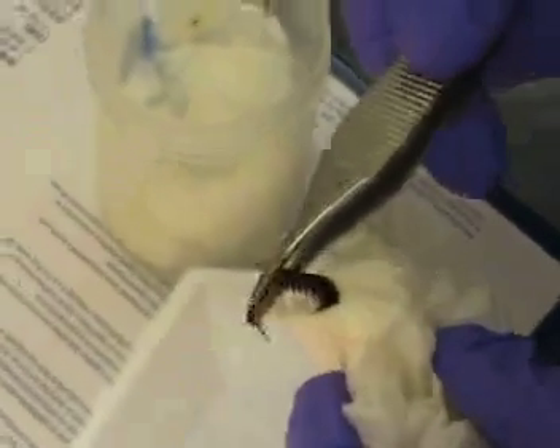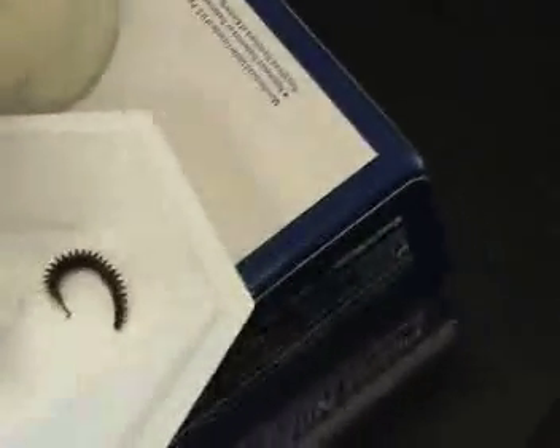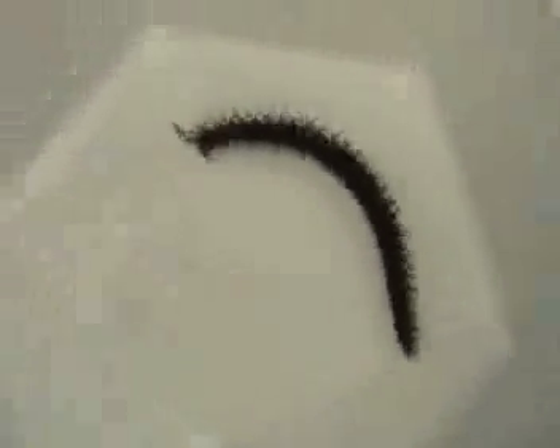It's stuck — oh no, look, it's running away! Wow, it ran pretty fast! What are we gonna call this one? We'll find out. Oh there it goes — hey, it's actually moving. Those are the mouth things, yeah. It's dying — it's going to squirt out. It's only supposed to be two to five seconds, so maybe this is a very slow process. It didn't squirt out the slime? I think it did — oh yeah, the slime is there on that side. Slime — cool!